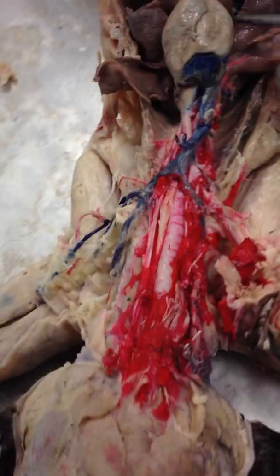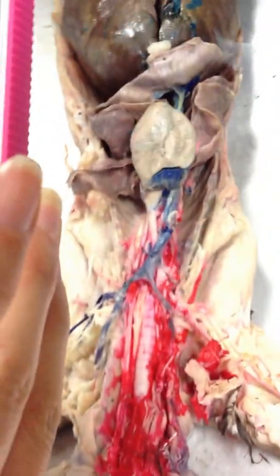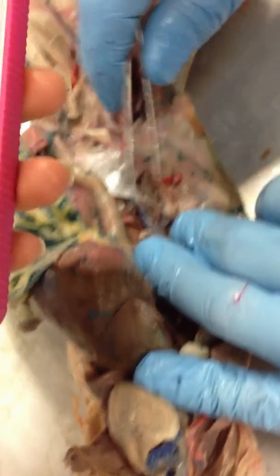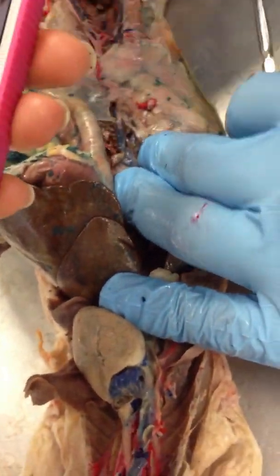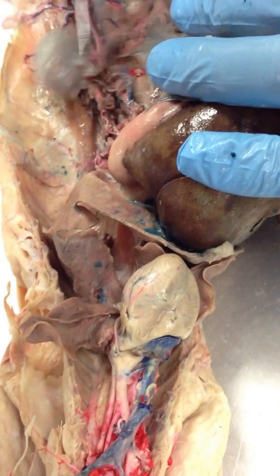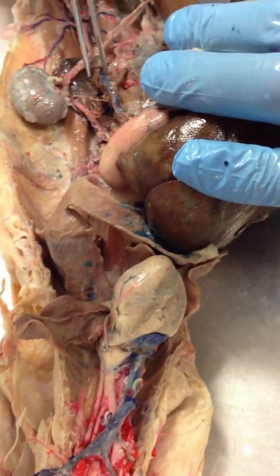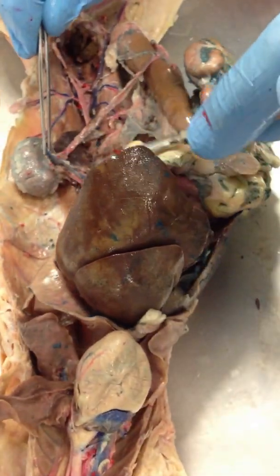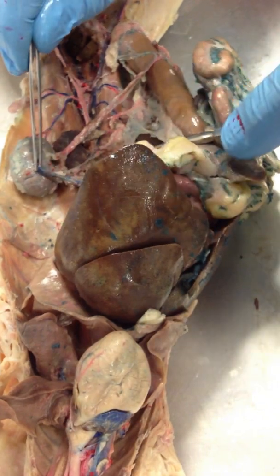If we go to the inferior side of the heart — the posterior on the cat — this is now our post-cava right there. The post-cava is going to continue down through the diaphragm. There's our post-cava there. It branches into the renal vein, which is right here.